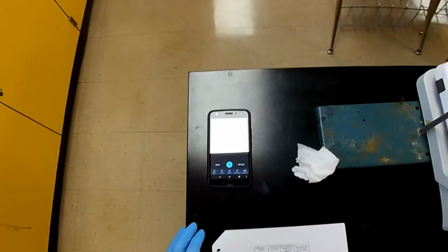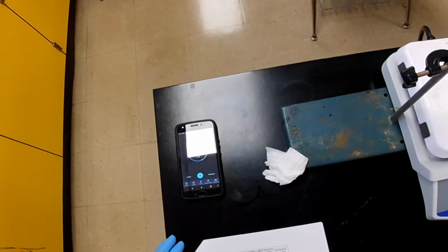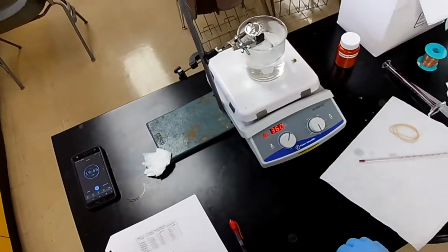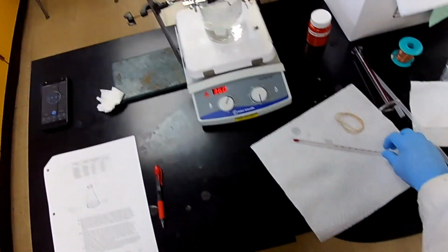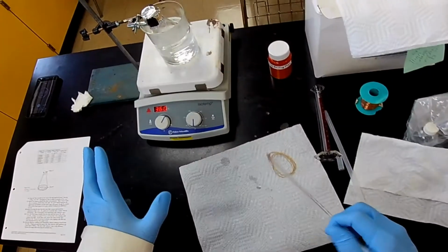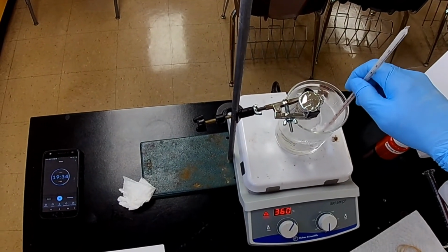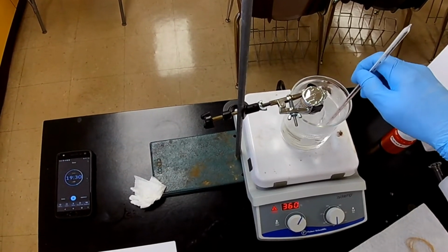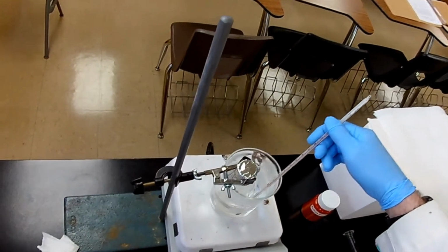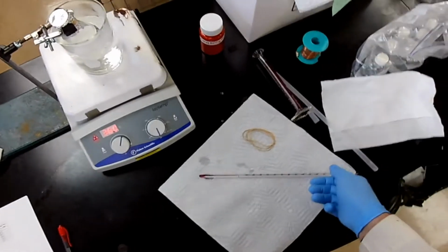Let's see. It's already been a couple of minutes. Let's give it another 5. I was watching my timer. And be sure. Okay, the water's still boiling. That's good, because we want to measure the temperature as well. Okay, we'll come back and get that.